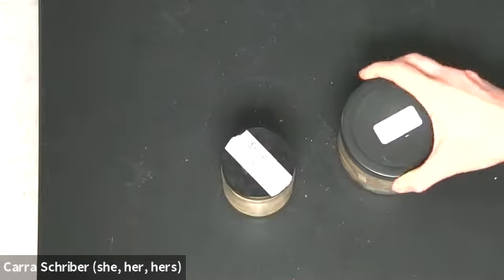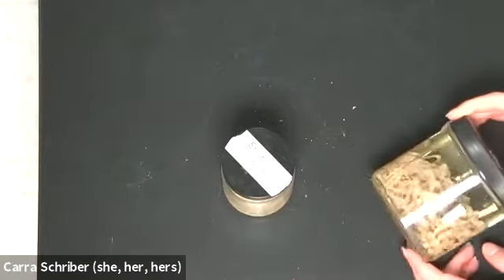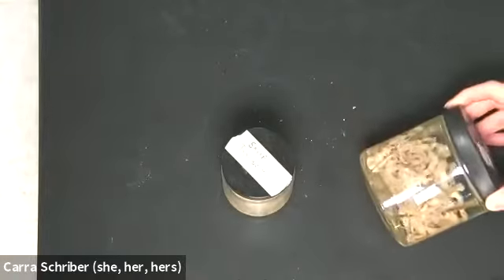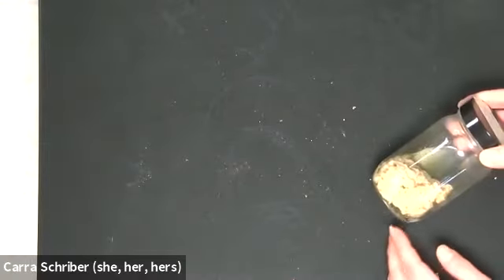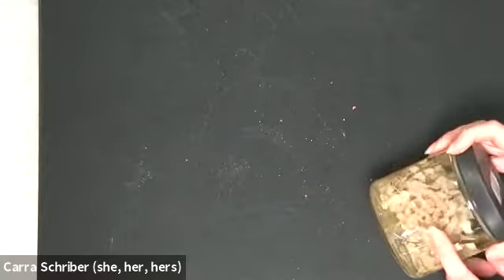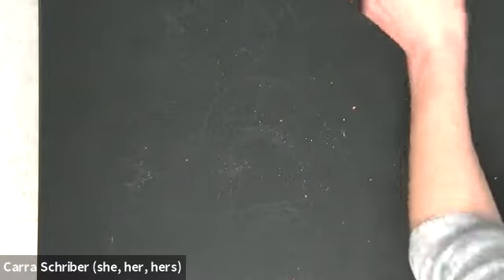This is kind of an interesting one to start with because they're flat, so it's hard to think about them having this mesoderm that forms all of these things on the inside, but truly this does have organs and such in the inside. And our flatworms are acoelomates, meaning that they have none at all, no coelom, no cavity for organ development. So it's kind of hard to see here, but tapeworm, very long ribbon-like worm.